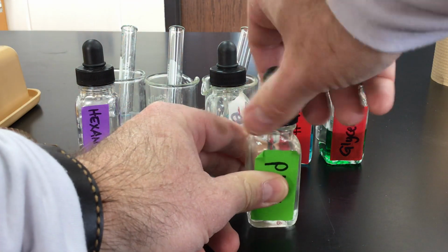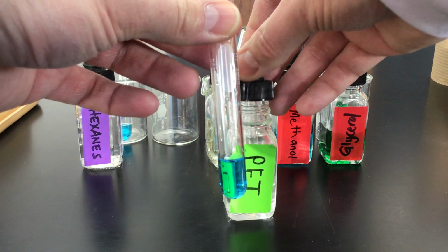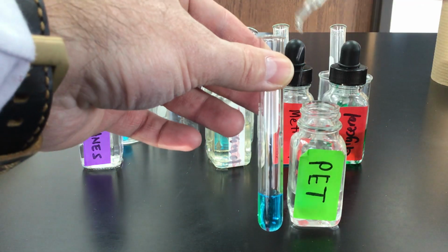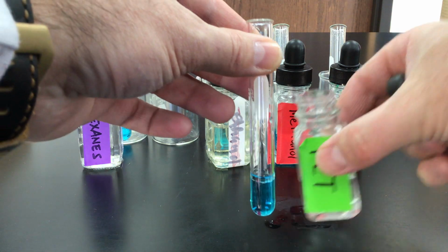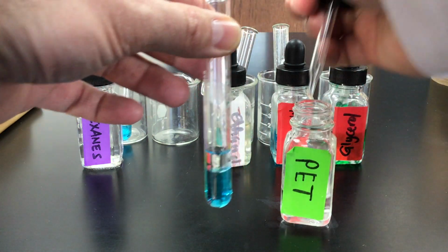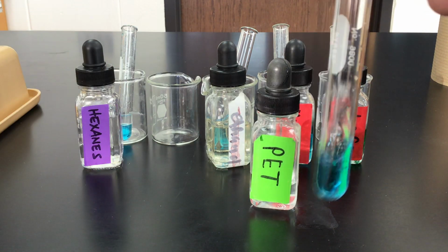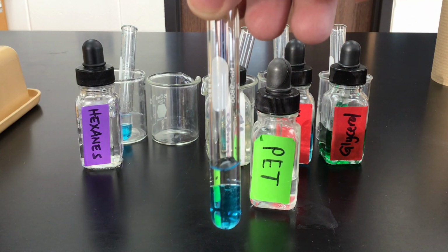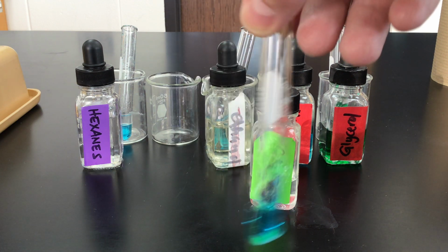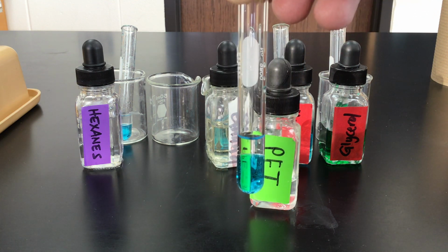Try the same thing with our petroleum ether now. So here's our water with a little food coloring in it. Squirt in the petroleum ether. It doesn't really like to stay in the bottle there. Pour some in here, in fact. Okay. So give that a little bit of a shake. And we can see the two layers there as well. And so no matter how much I mix these and shake these, those two are not going to stay together. All right.